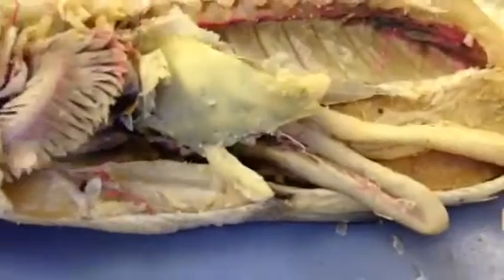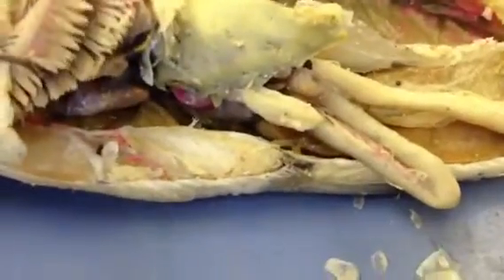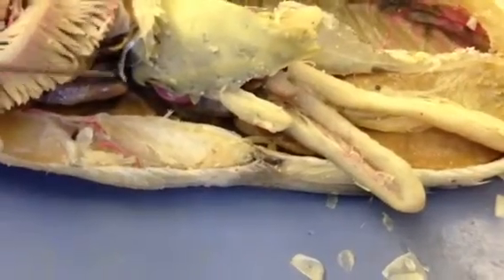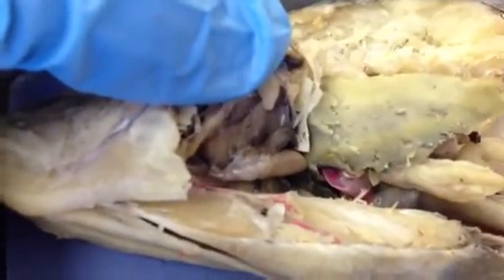And then for the heart, this is the heart right here. This clear plastic thing is the transverse septum. And the sac in between it, you can't really see it, is the sinus venosus. The dark thing right there, let me see if I can clip it up or have it stand up.